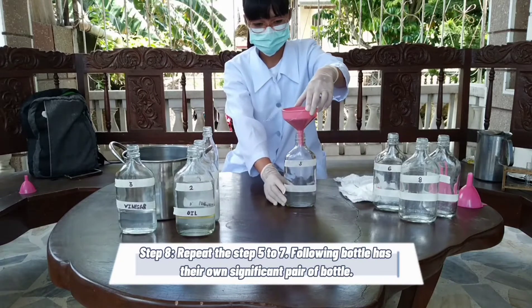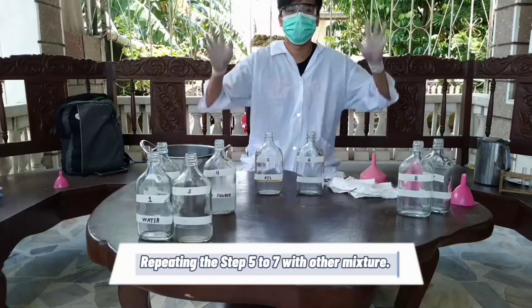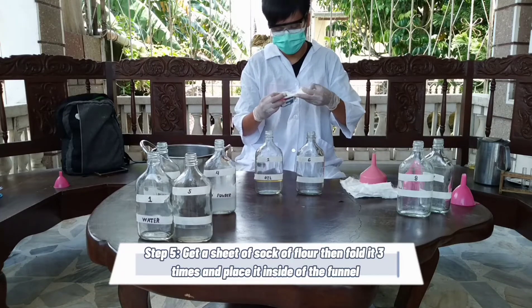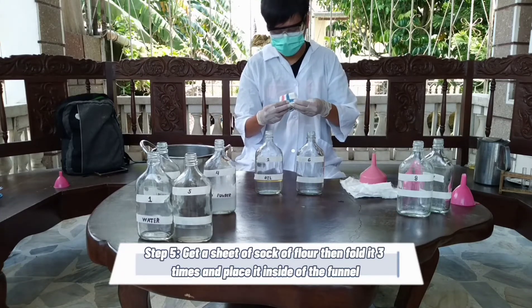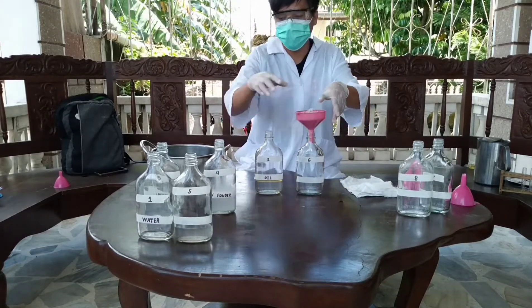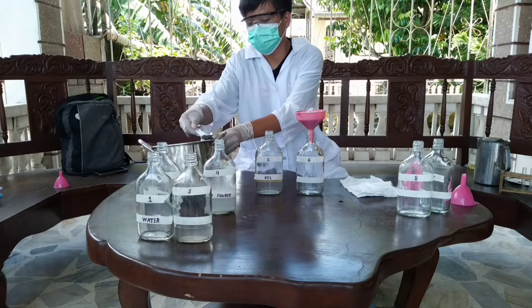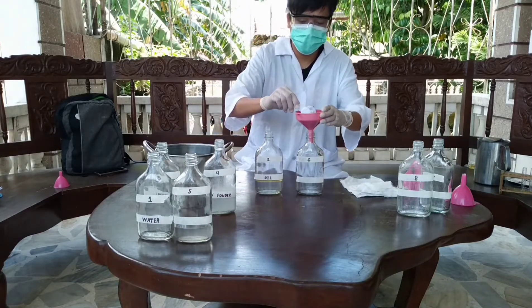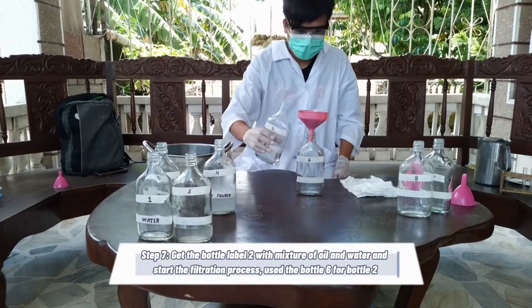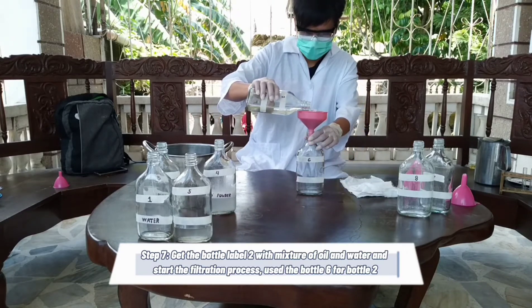Step eight: repeat steps five to seven — each bottle has its own significant pair. Step five: get a sheet of sack of flour, fold it three times, and place it inside the funnel. Step six: place a combination of sand and soil inside the funnel. Step seven: get bottle labeled two with the mixture of oil and water and start the filtration process. Use bottle six for bottle two.